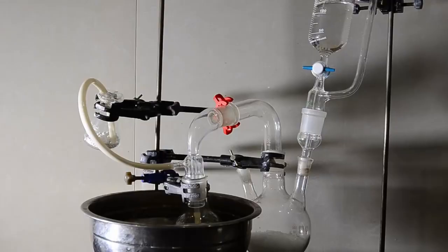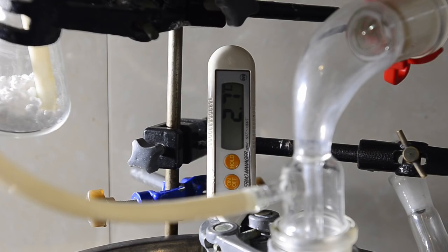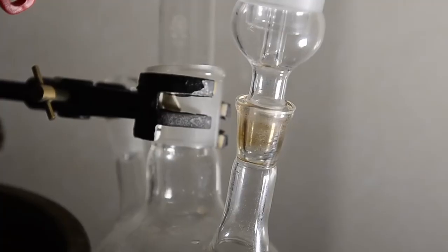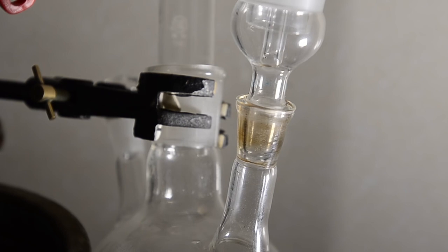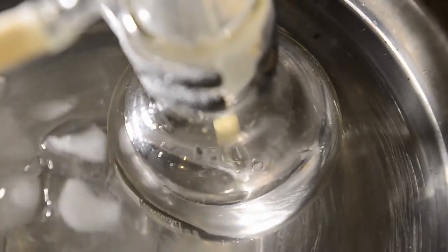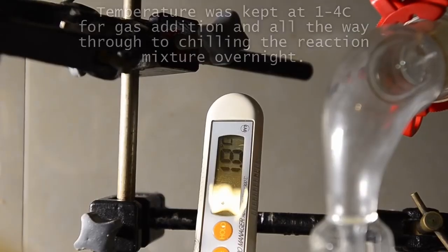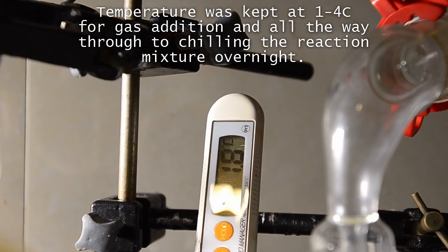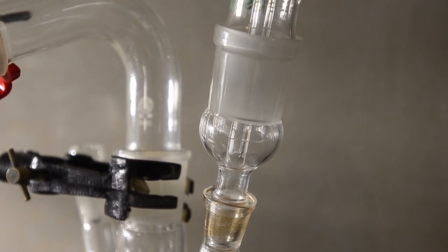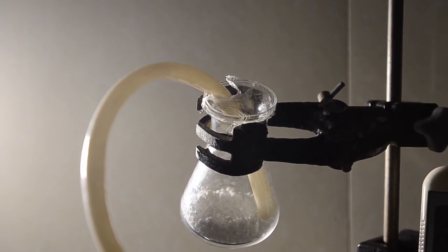We assembled the apparatus and attached a makeshift calcium chloride drying tube to the atmosphere outlet. We put ice and salt in the water bath to get the temperature down to below 5 degrees C, then began a slow addition of the sulfuric acid to the sodium chloride in the gas generation flask. First we got bubbling as air was displaced, then noticed the HCl gas was dissolving in the liquid. Since the first test reaction got quite warm, we went slowly and kept the temperature low, finding a rate of acid addition that kept the gas dissolving throughout the reaction with hardly any HCl escaping from the drying tube.